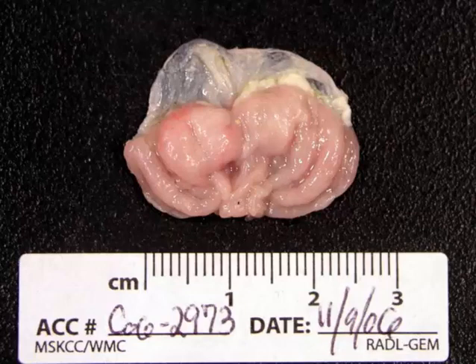There are a number of other causes here too, including experimental infection with Helicobacter felis, experimental infection, especially of immunodeficient animals, with Taenia taeniaeformis. You can see this in any other lesion.